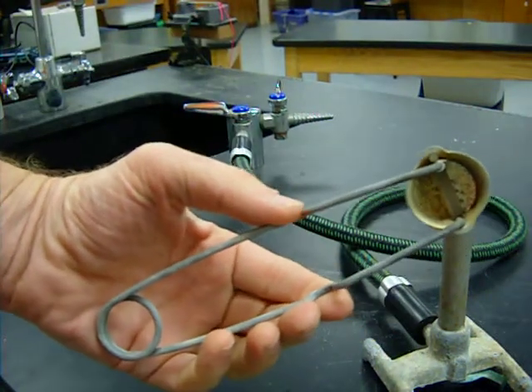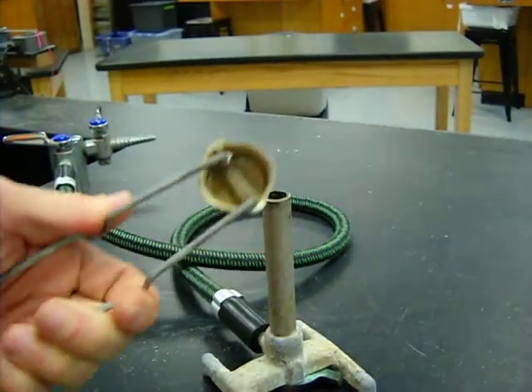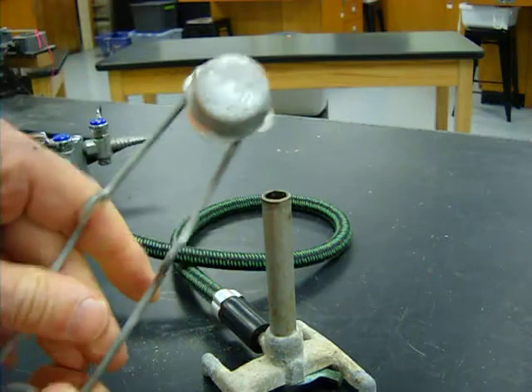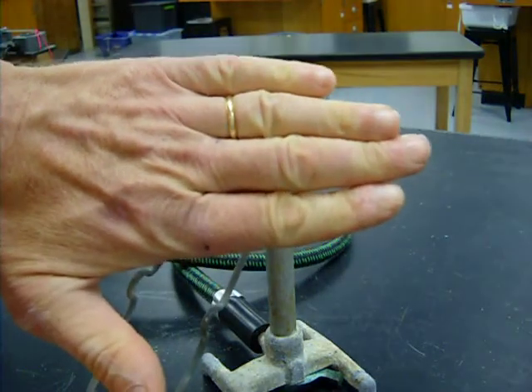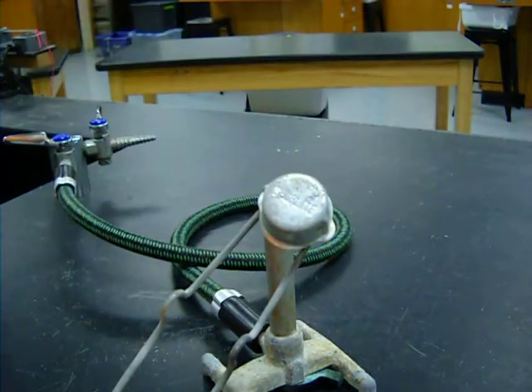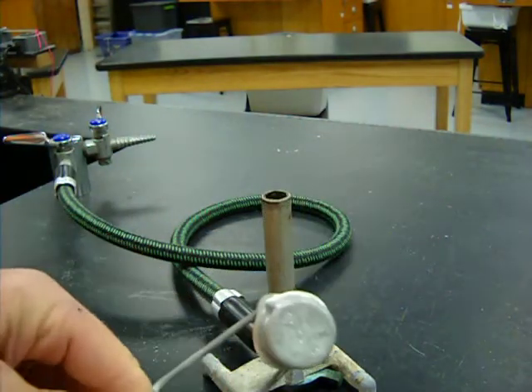Now, this is my lighter. It is simply a flint and steel. We're going to hold the sparking part near the flame and the cap towards me so that it shields me a little bit from the flame, which is going to be pretty high when we start it out. Let's have at it.